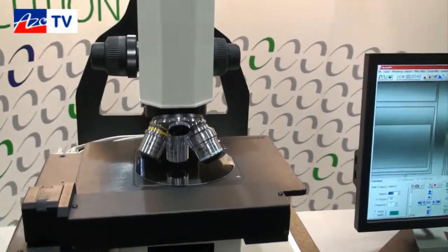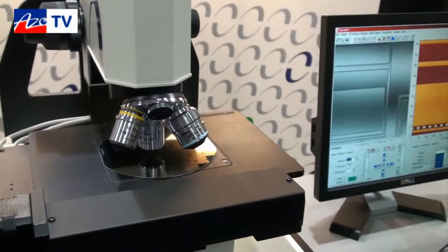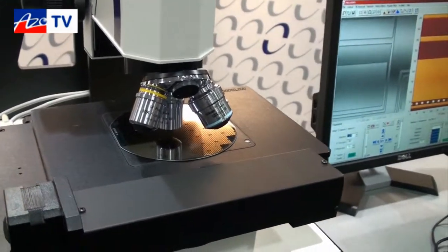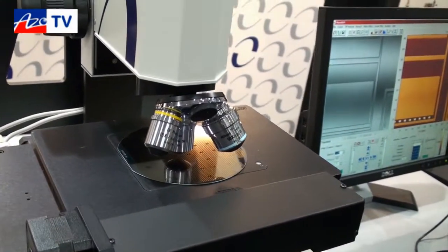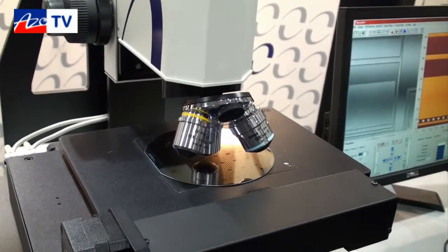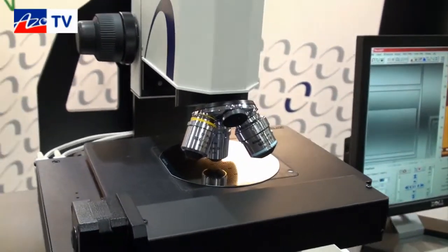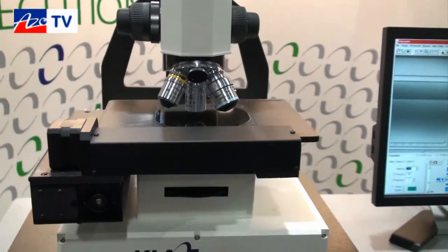We're basically reflecting the light off of the surface and off a reference mirror inside of the objective, and we're looking at the change in the optical path difference to make our measurements. The beams recombine and create what we call a fringe pattern.